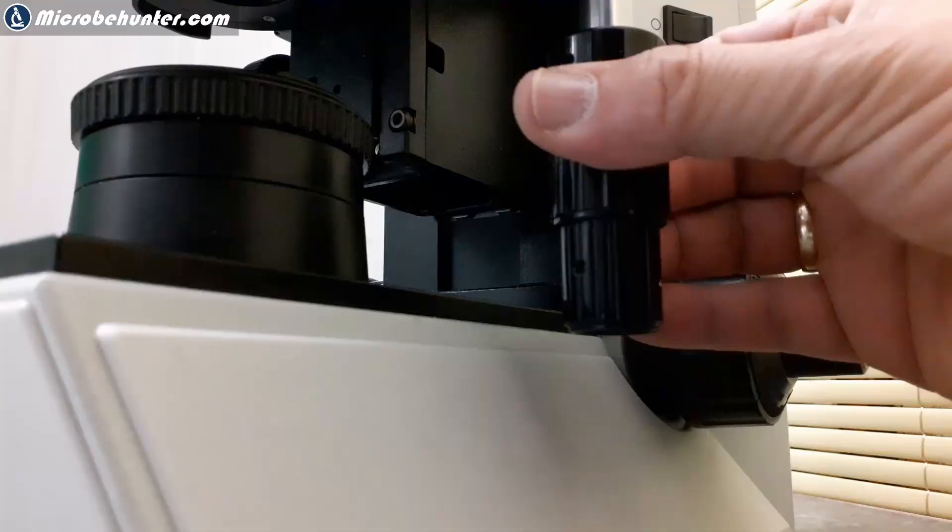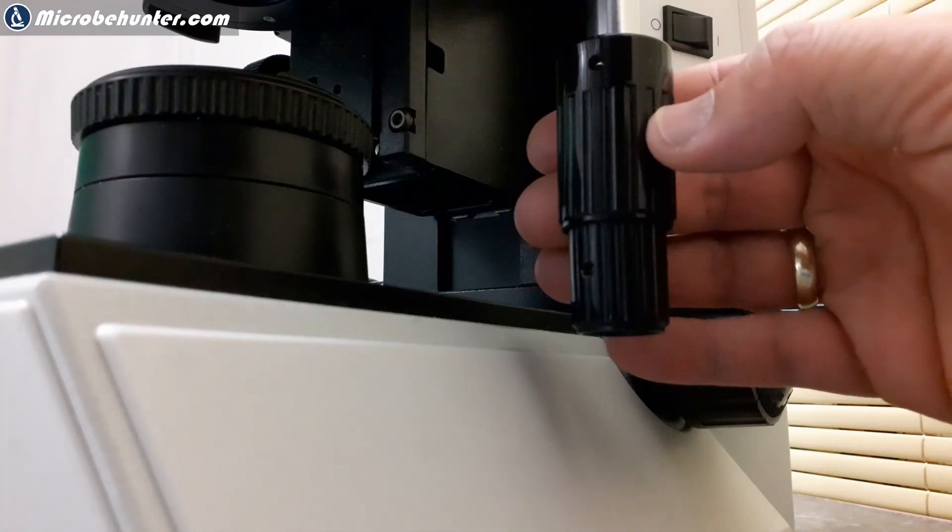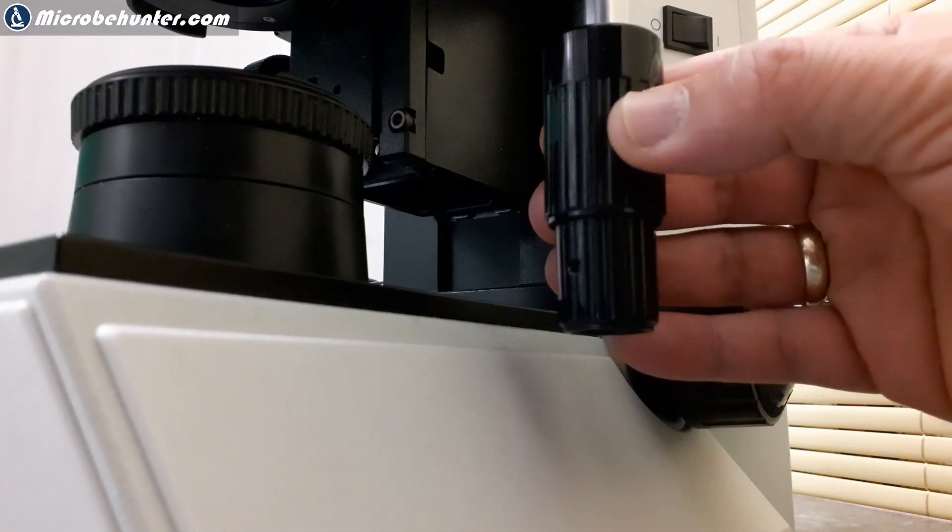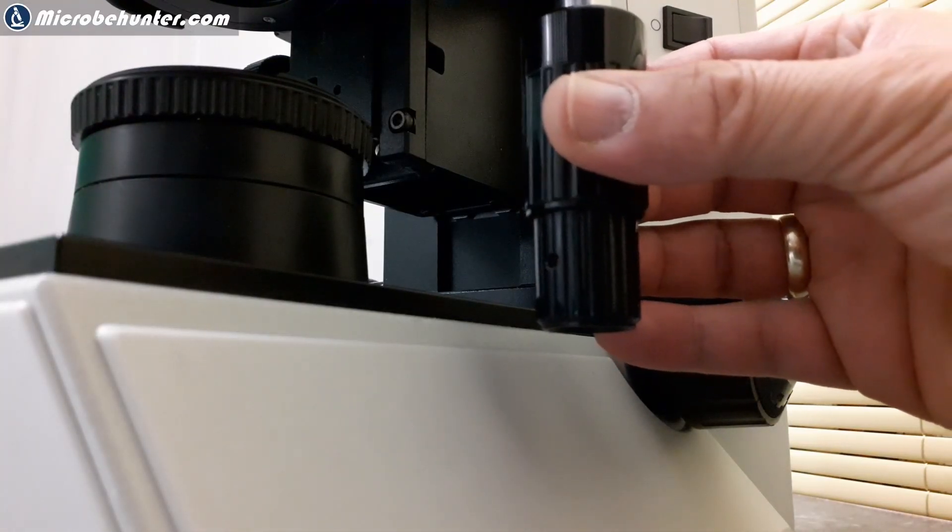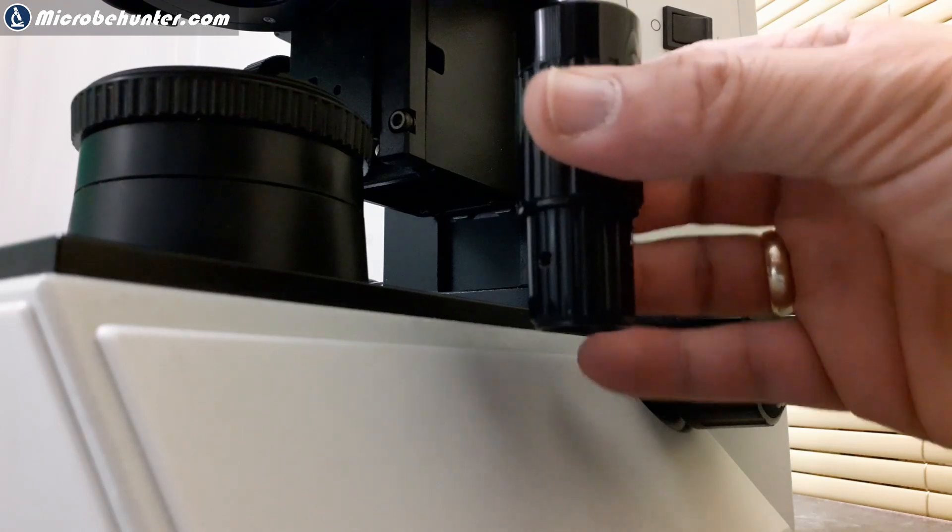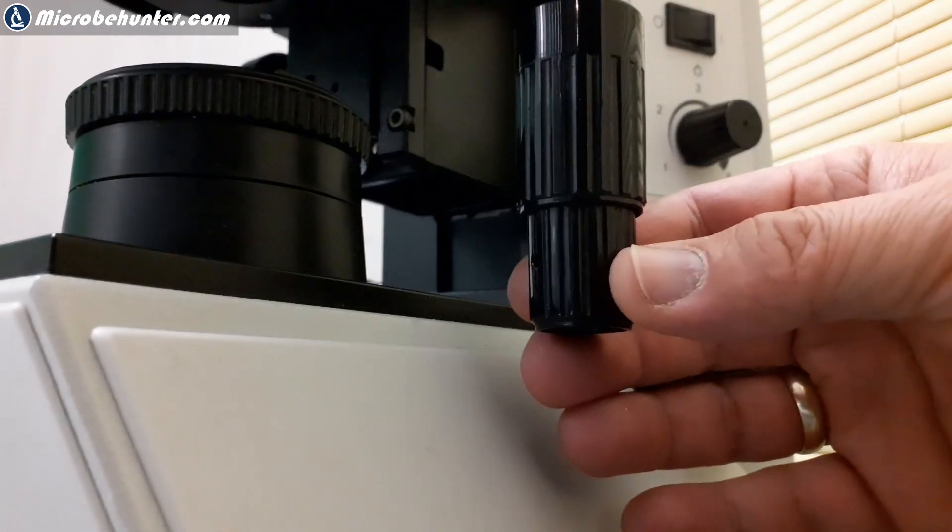But there is a problem when turning the mechanical stage. It's almost impossible to turn it in a completely smooth way. Usually there are always some kind of irregularities that you might see, and this might distract a little bit.